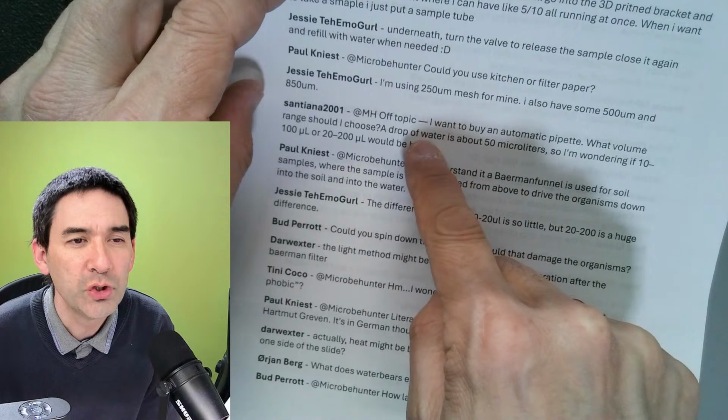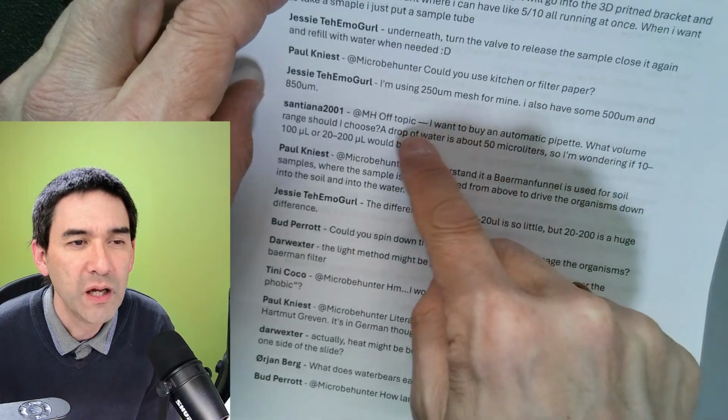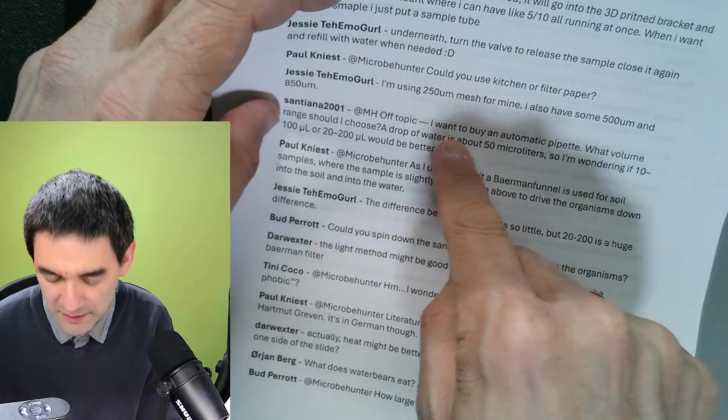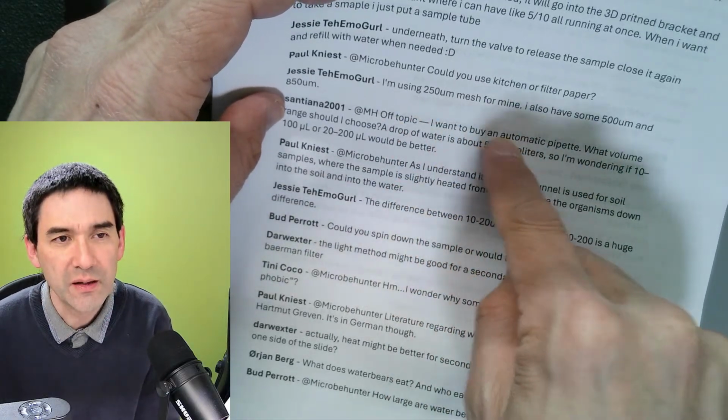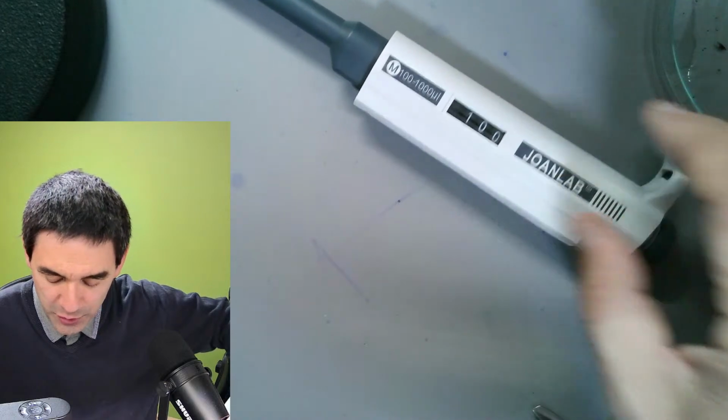I want to buy an automatic pipette. What volume range should I use? A drop of water is about 50 microliters, so I'm wondering if 10 to 100 microliters. Okay, so this question here is what you want to buy, a microliter pipette, and the question is which one should you buy? Honestly, it's a question of personal preference.